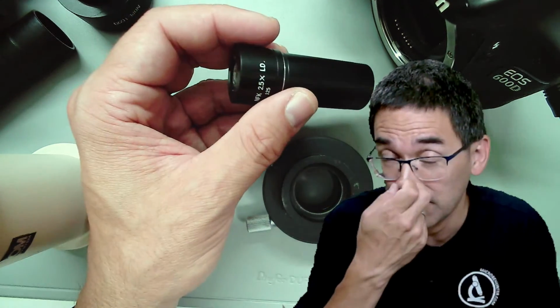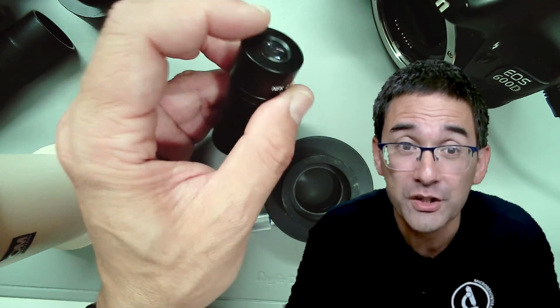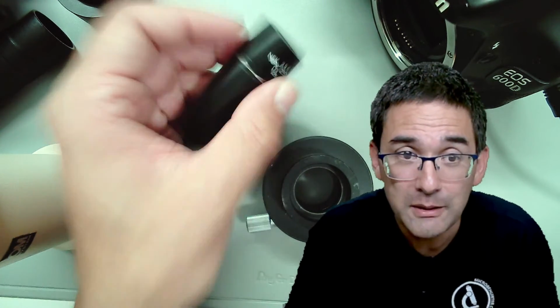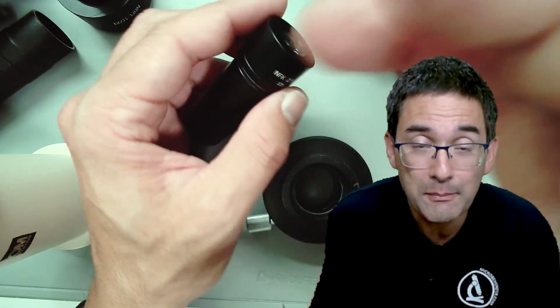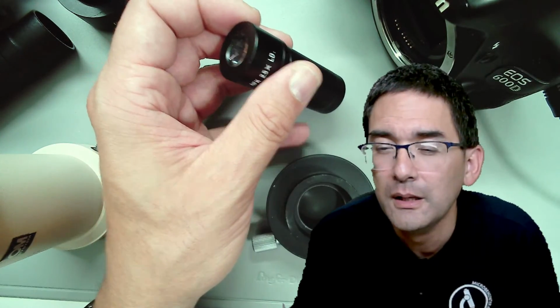I remember €600, $600 to $700 just for this thing here, for the smaller sensor, because when digital cameras came out, people immediately bought those, because then they got the maximum field of view, and the prices exploded here.